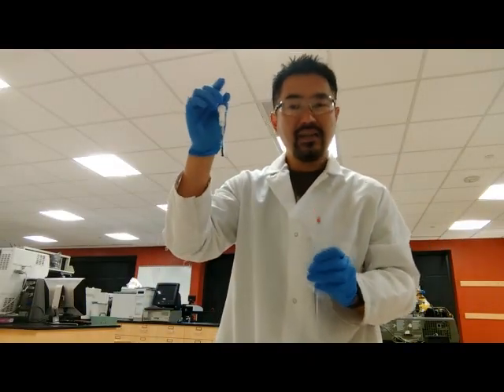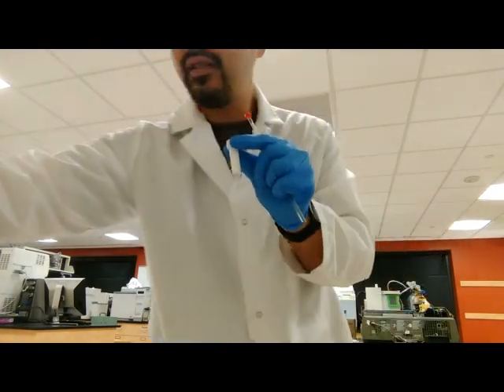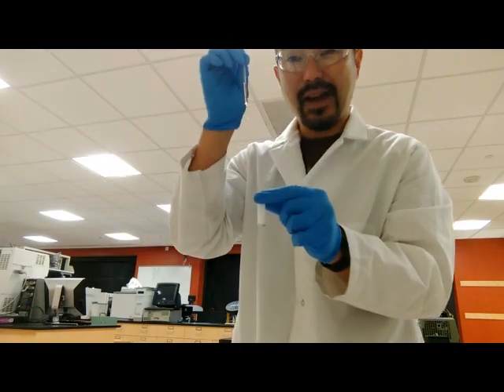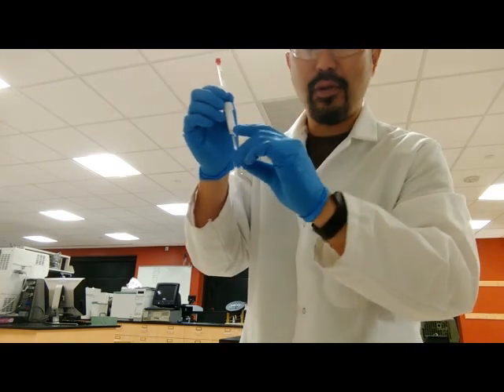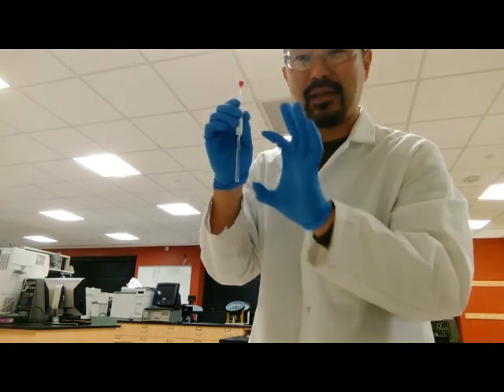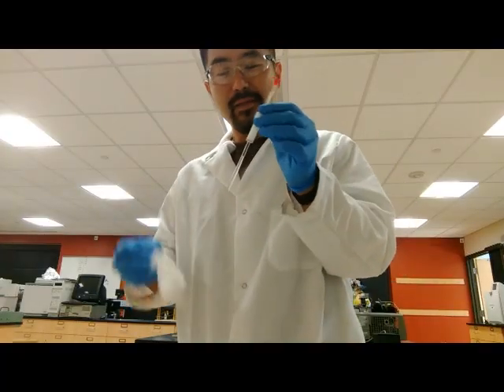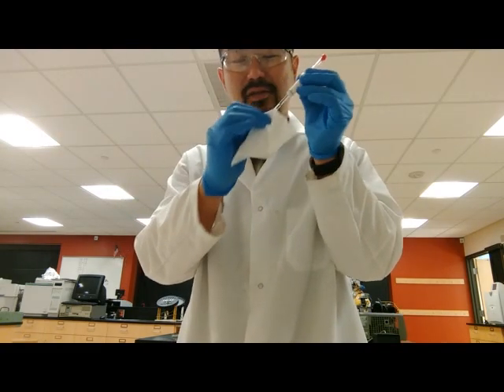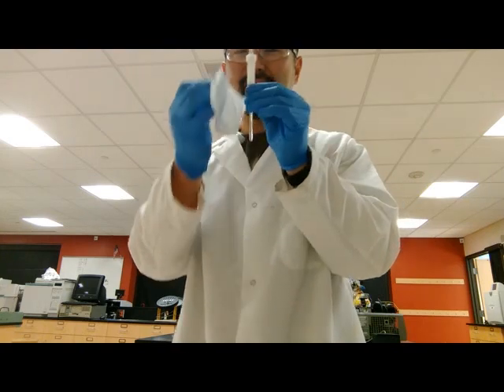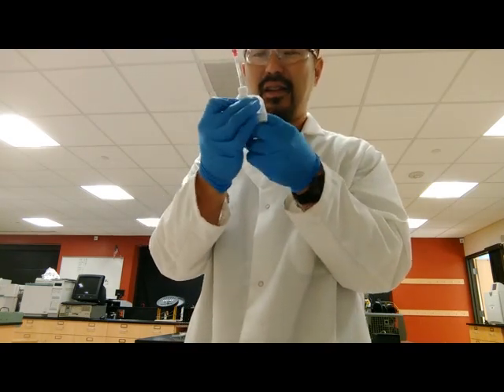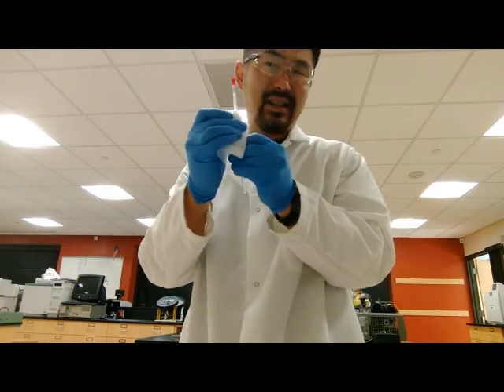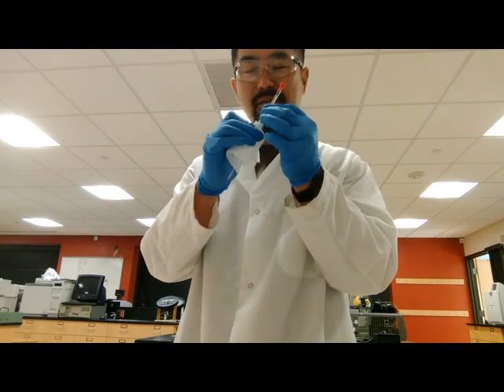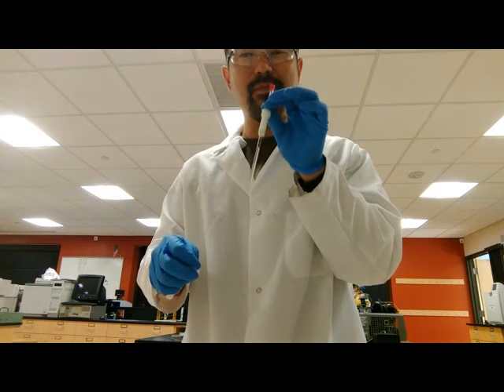Now that I took the sample tube out of the machine, I'm going to take that holder off of the other tube and then put my sample tube through the sample tube holder. Now it's important that this height is at a very particular precise height. Before you insert your sample though, you will want to make sure that this portion of the tube is actually especially clean as well as the spinner or the sample holder. If it has any fingerprints or anything like that, that would be sticky enough for this to get stuck inside the NMR tube or NMR instrument and it will not spin properly.